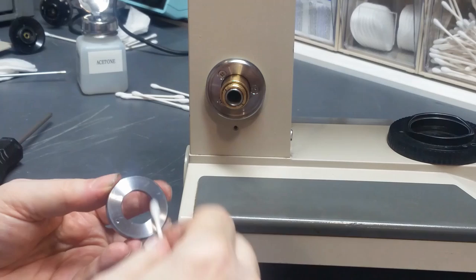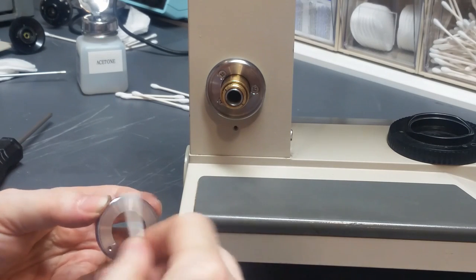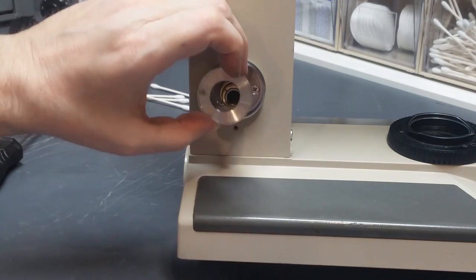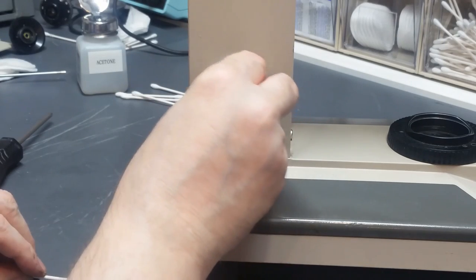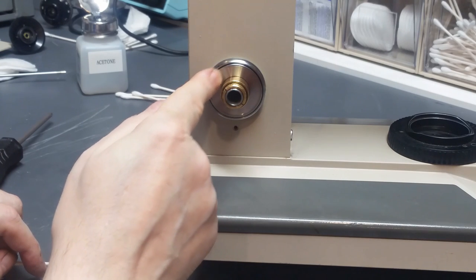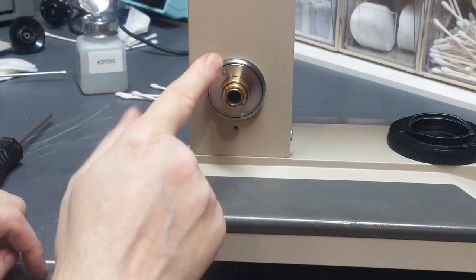Similarly, I'm going to clean this surface here, get that as clean as I can, and give it a few seconds to evaporate, and put it in there. Now, if I did my job properly, and it looks like I did, this slides very smoothly. There's no stickiness, no grabbiness, none of that stuff.